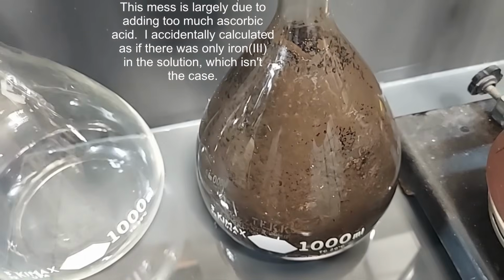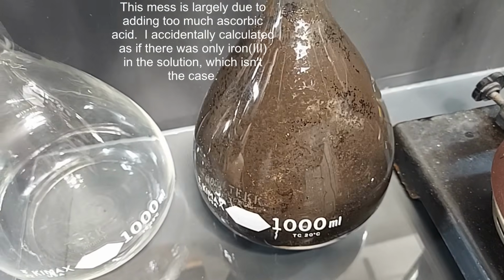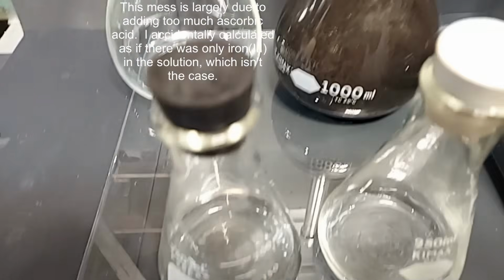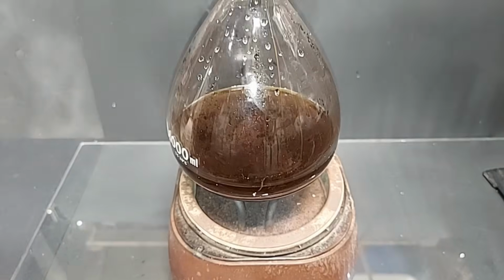And of course, whatever was left in here didn't make it over, and there's quite a bit of solids that ended up forming. That's going to be a nightmare to clean up. But anyway, I just wanted to explain the situation here. Everything's been cleaned up and reassembled, all set for take number 2.